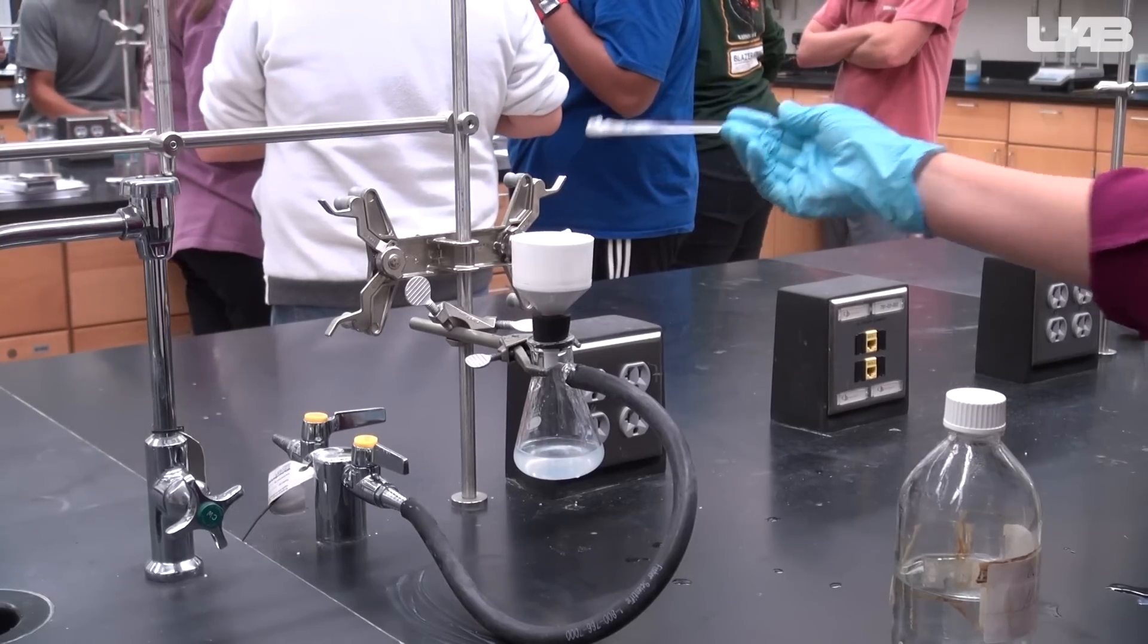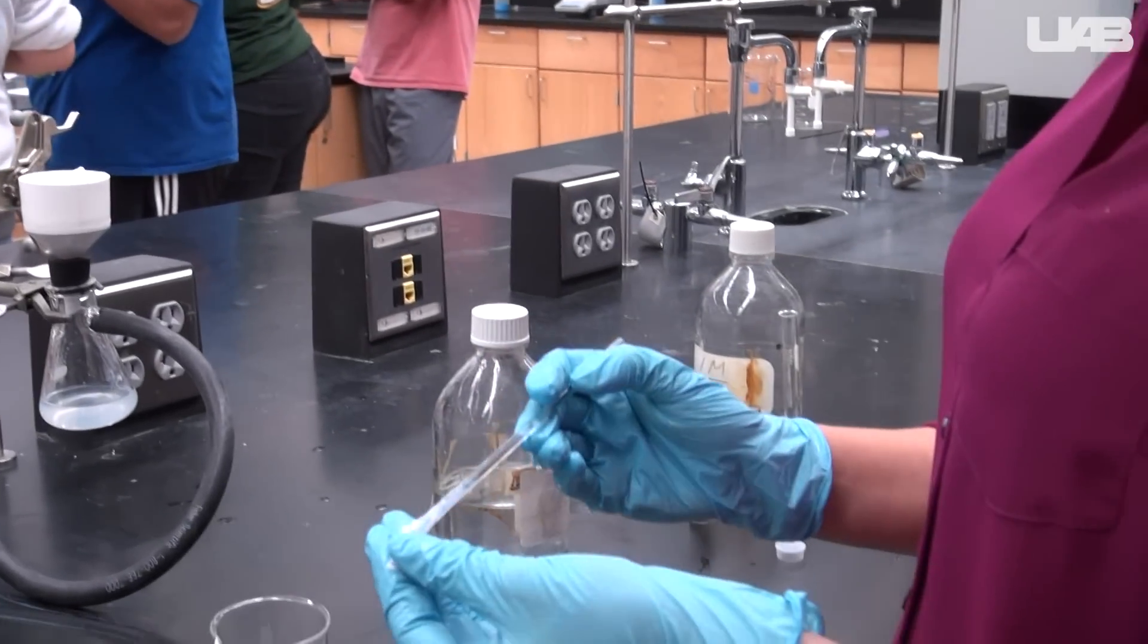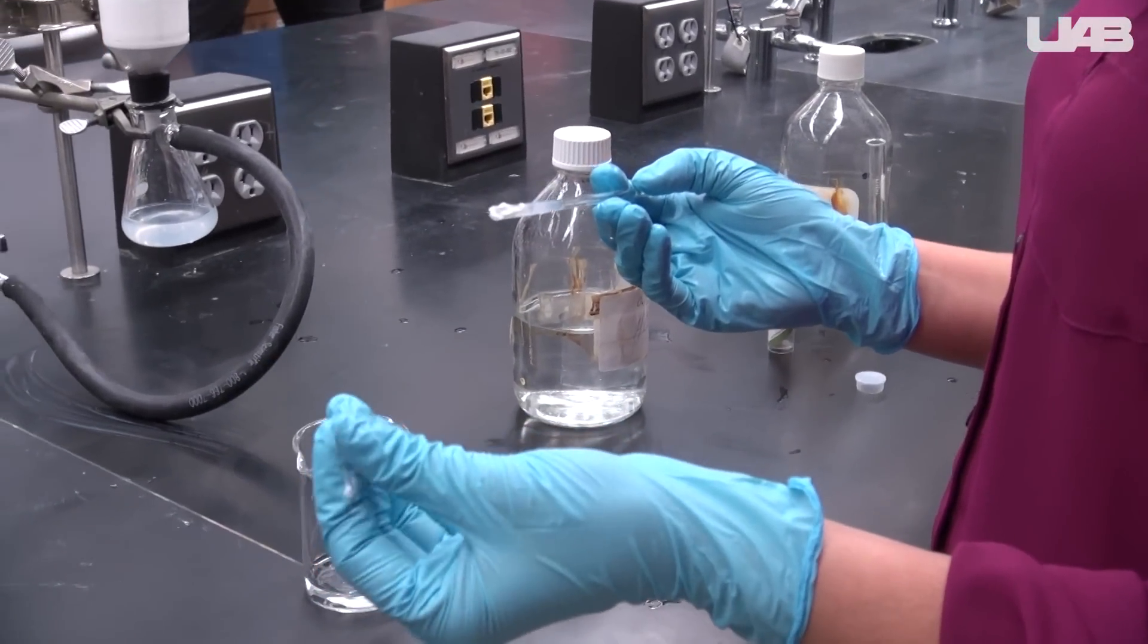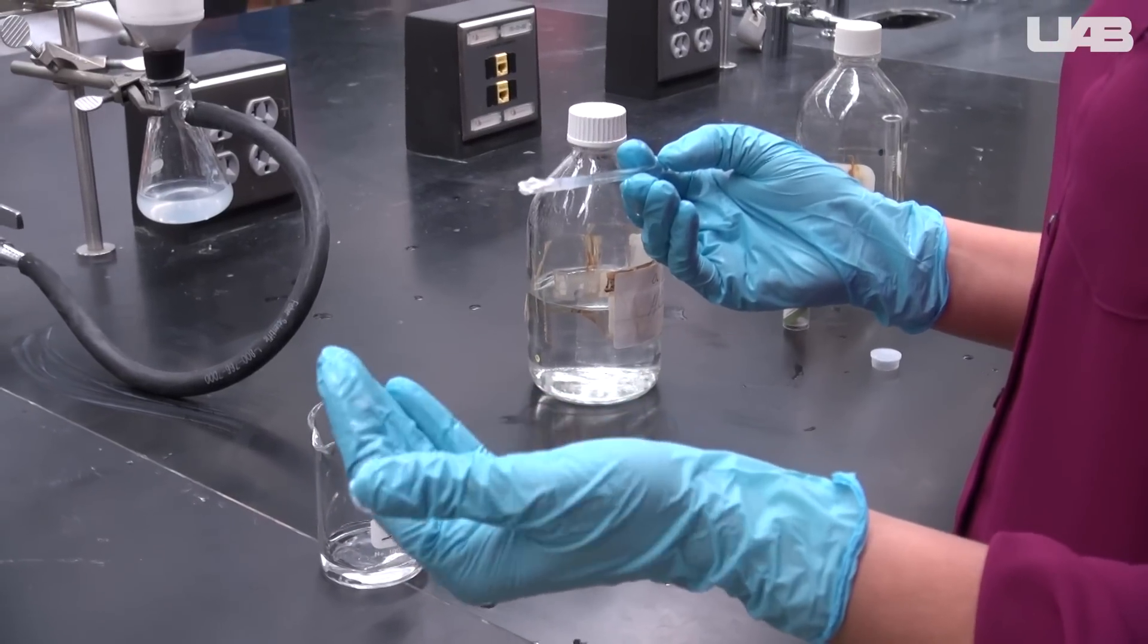Once you are finished filtering, you should put on your gloves and examine the consistency and texture of the solid that was formed and record your observations in your notebook.